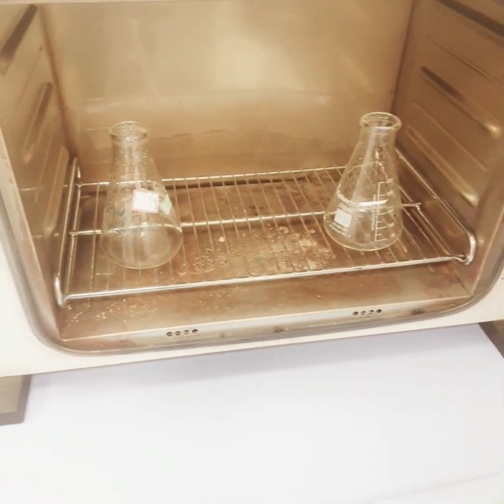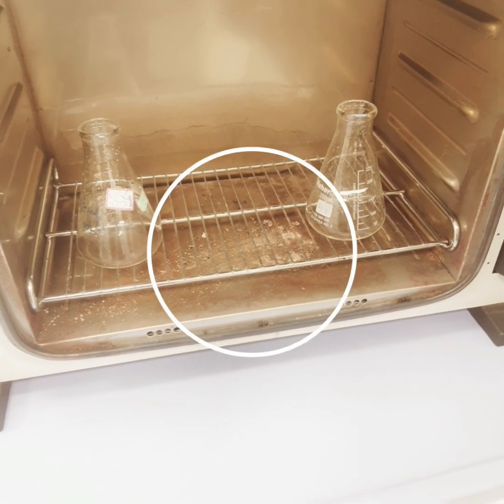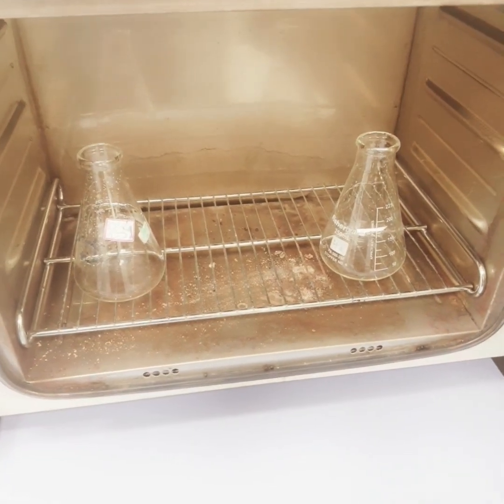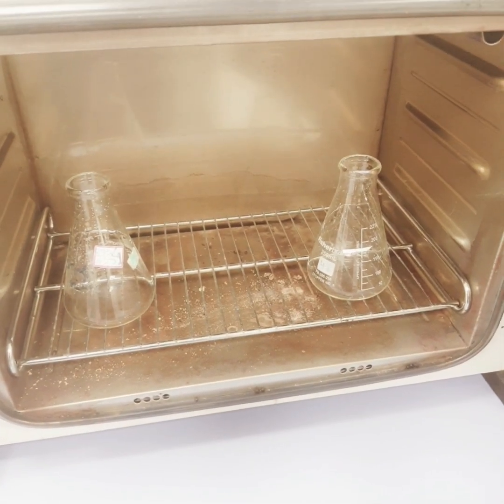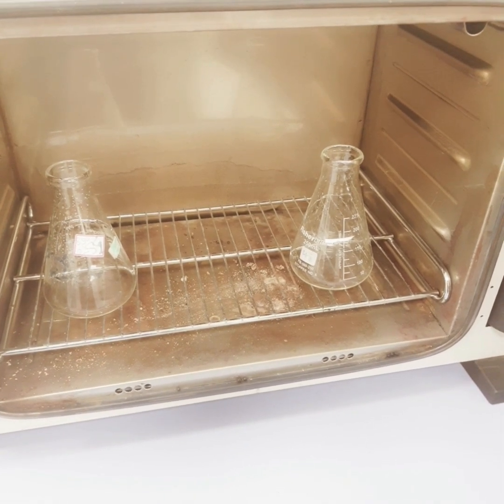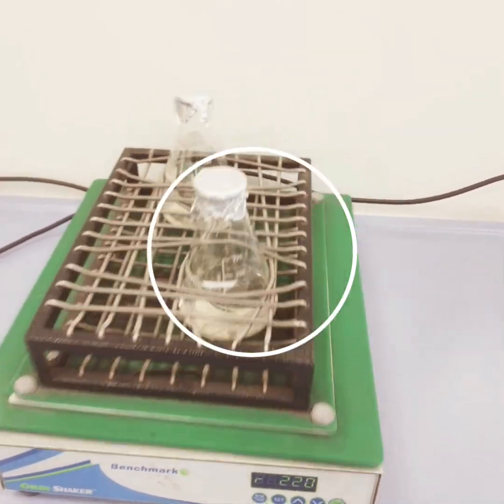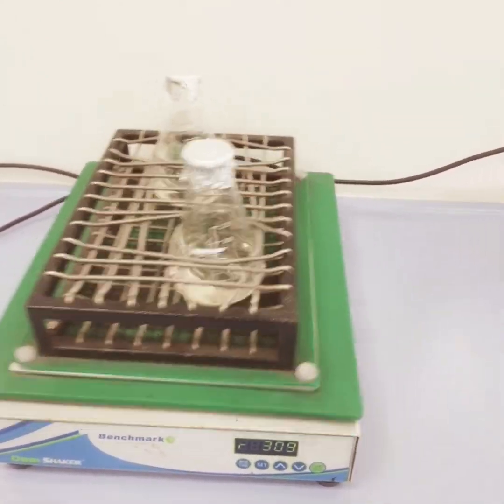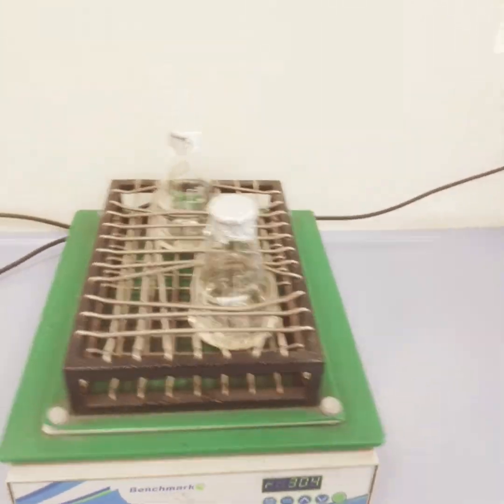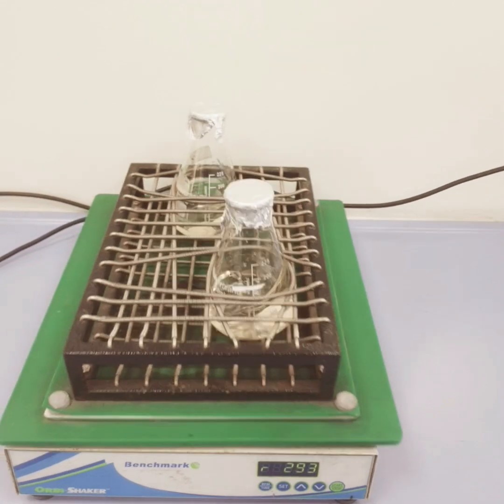After drying, I will take the conical flask with the membrane, and I will assume that the adsorbent weight has not reduced. It is similar to the 10 milligram, because these are not fine solid particles, these are membranes. Now I will start the second adsorption desorption cycle. This is my regeneration or desorption cycle, because we have desorbed using UV and also soaked this in 0.1 molar HCl.